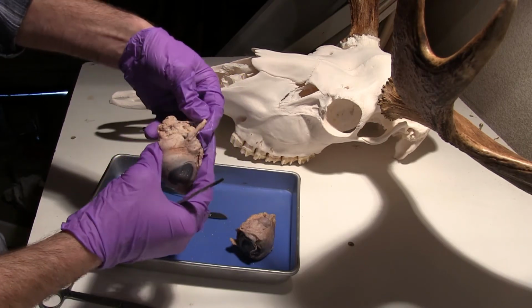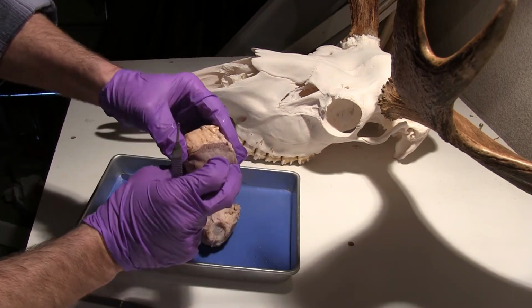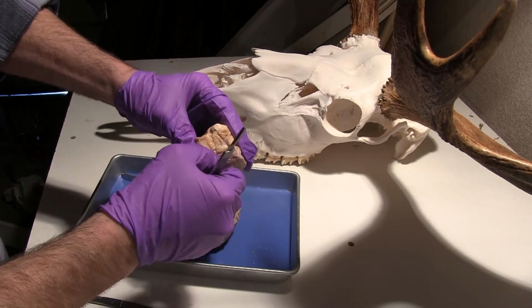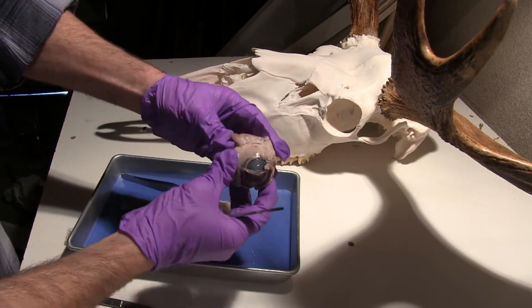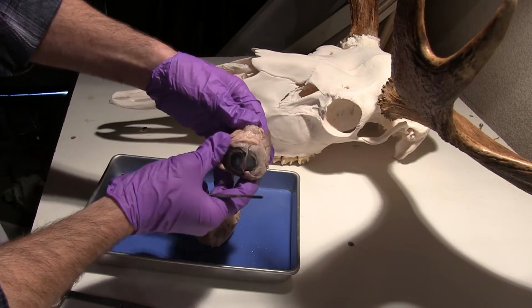Now we'll also see some tissue that looks a little bit different, and I know I saw some on this. So this right here is actually skeletal muscle. So this is one of the extrinsic muscles of the eye. This is what's going to allow us to pull the eye in a certain direction to point or aim the eye.